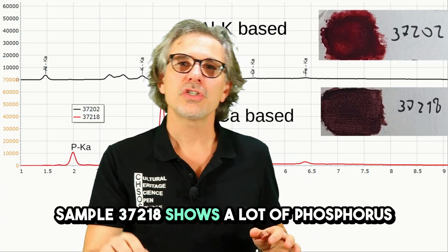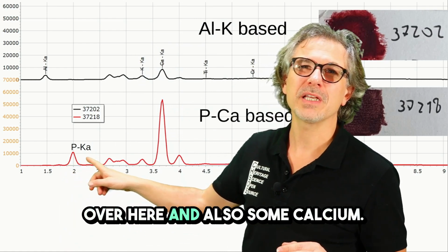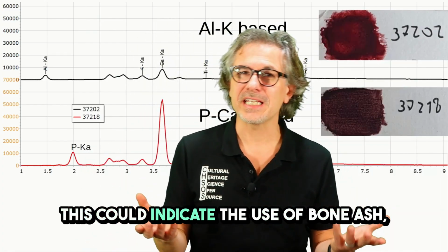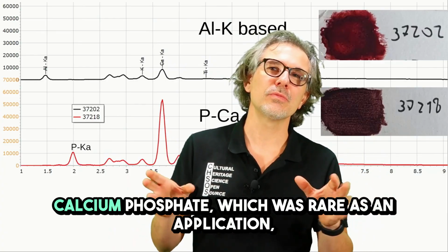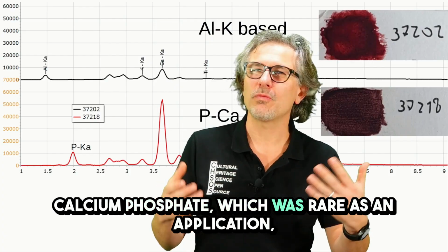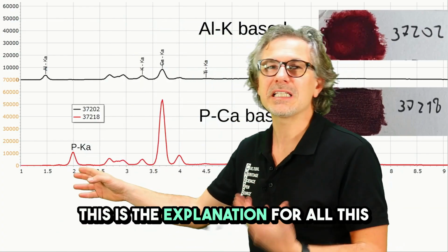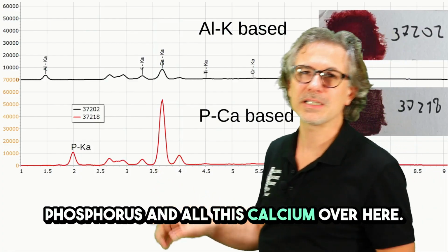Sample 37218 shows a lot of phosphorus over here and also some calcium. This could indicate the use of bone ash, calcium phosphate, which was rare as an application, but still could be the case. This is the explanation for all this phosphorus and all this calcium over here.